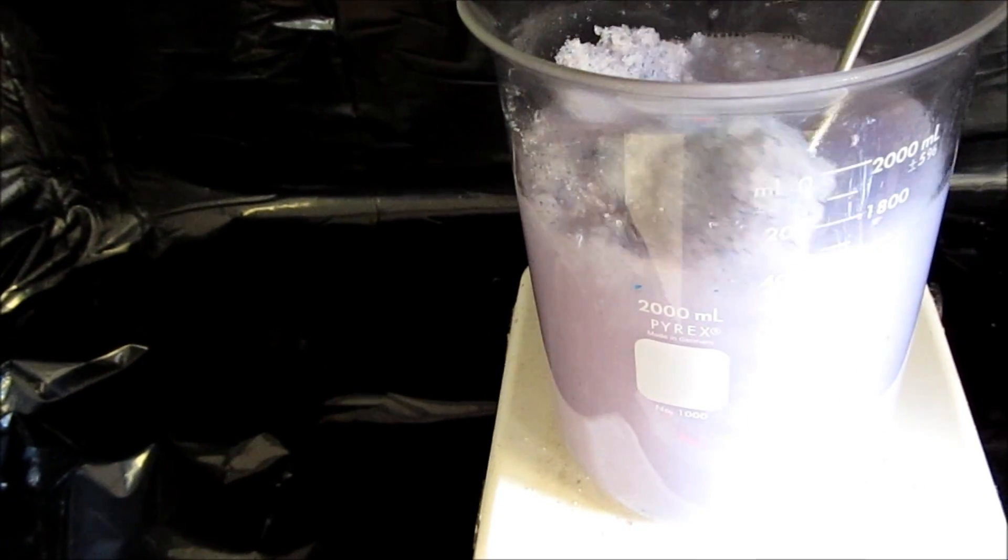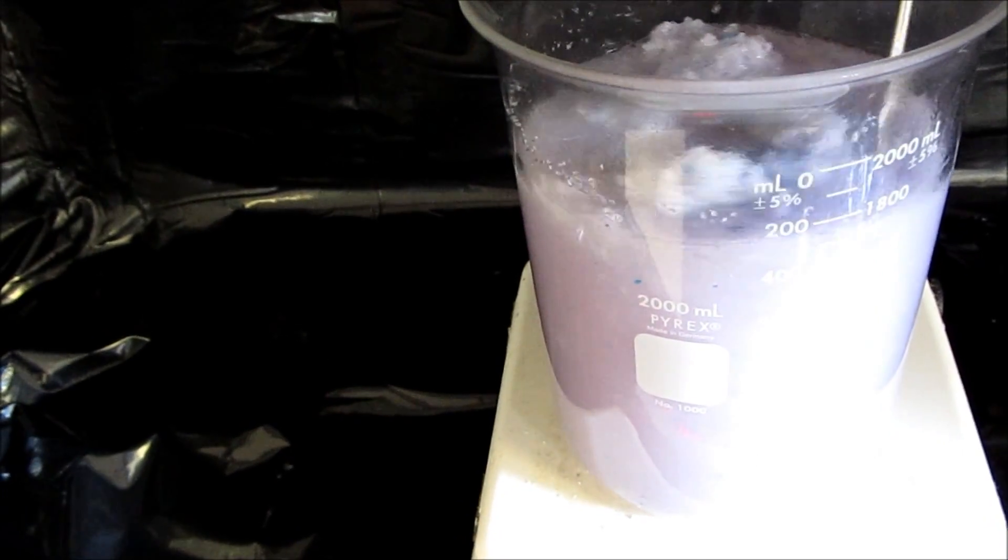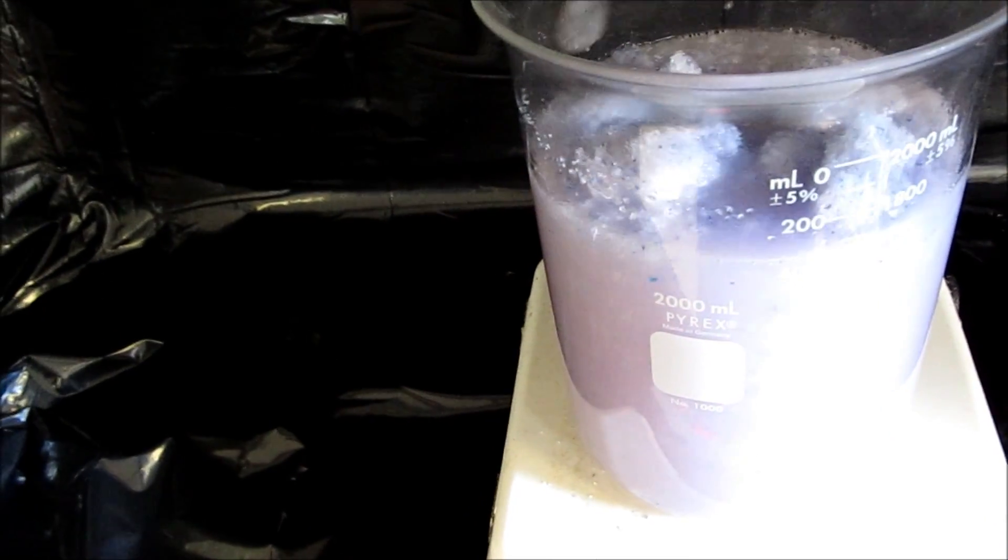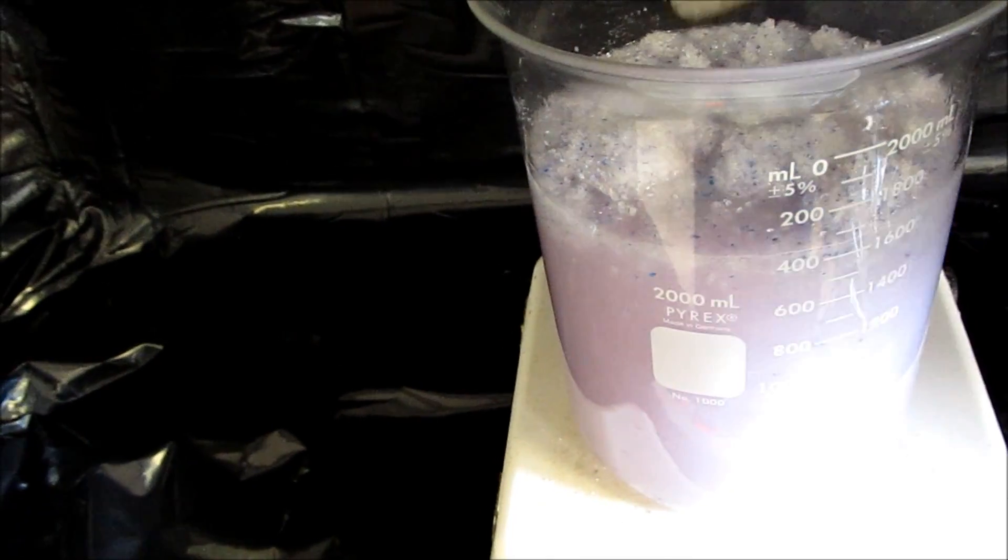Alright, we're doing a separate procedure. I'm going to let this in here and get hot and boil and I'll come back in a few minutes. Make sure it's not boiling over or splattering all over the place.